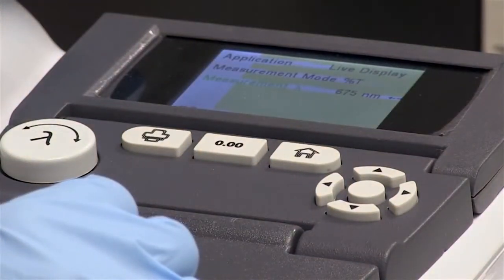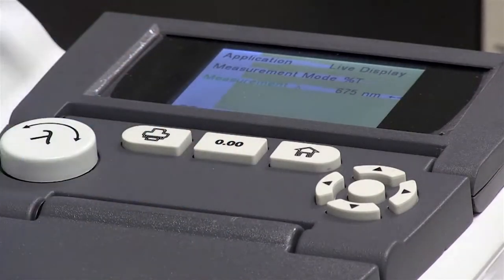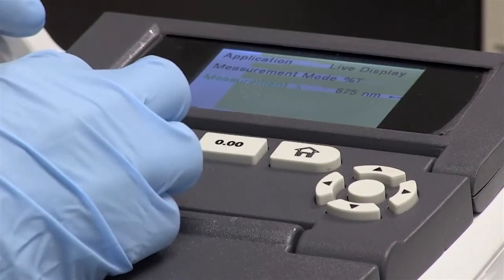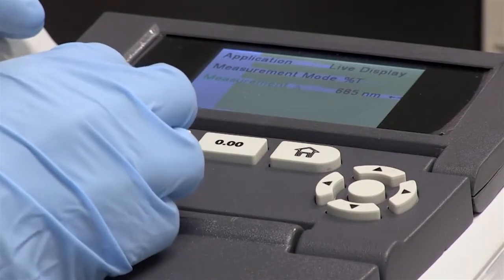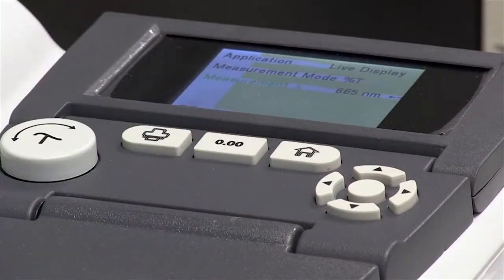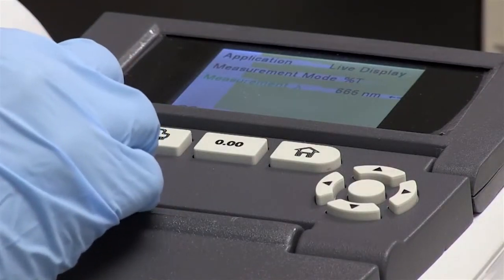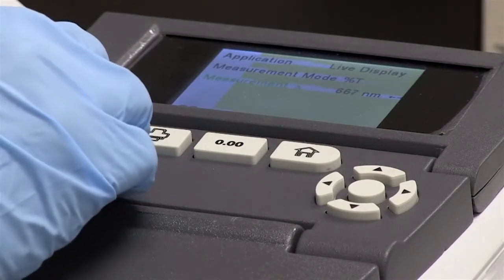If you want to change the wavelength in increments of 10, you can use this dial over here to the left, marked lambda. Turning it clockwise from 675 will take you up to 685, and turning it anti-clockwise will take you down to 665. You can also use this dial to do fine adjustments — if you press down on the knob and turn it, it will go in increments of one nanometer, either up or down.